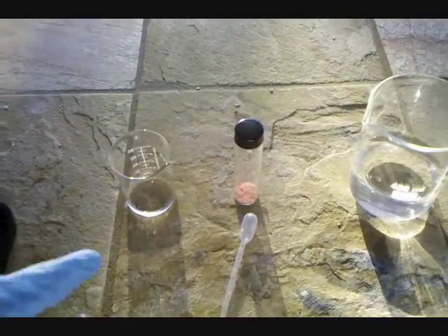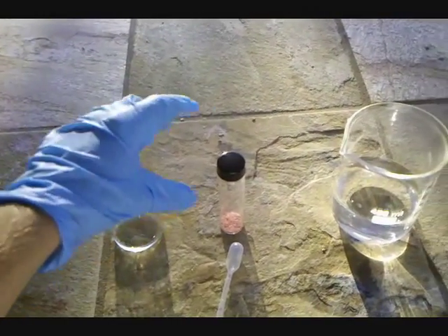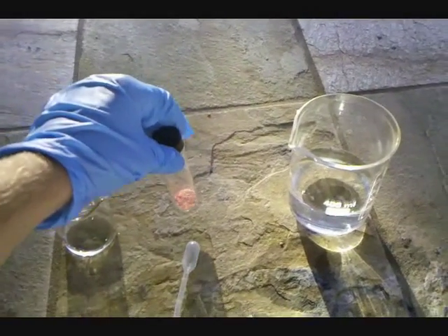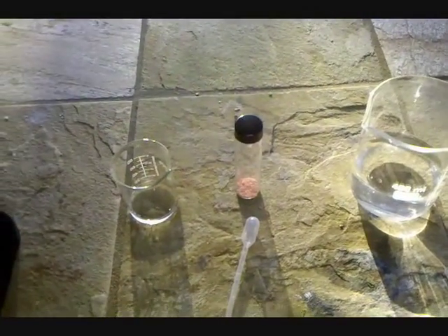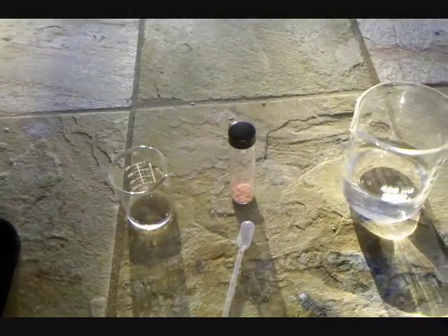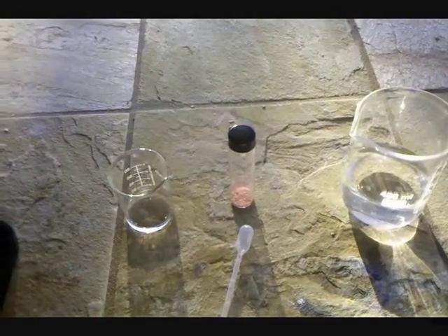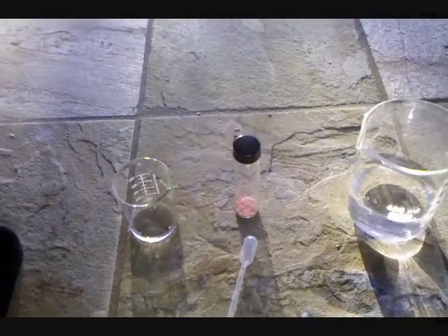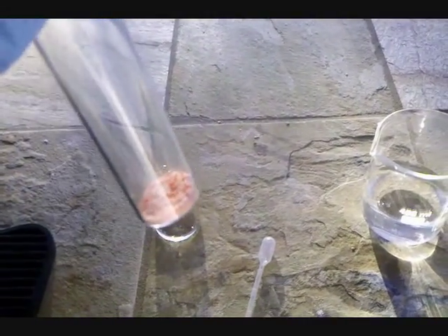For the synthesis, concentrated sulfuric acid is added to a vial containing sodium chloride and potassium dichromate. The ratio is: for every gram of potassium dichromate you have, you need 0.8 grams of sodium chloride. It's a good idea to use kosher salt because potassium iodide in regular table salt will react with concentrated sulfuric acid to yield iodine.